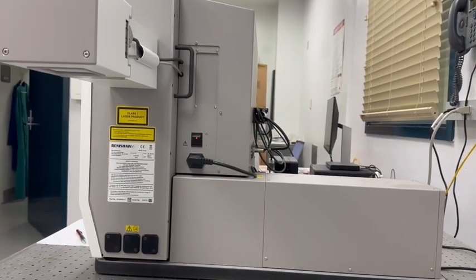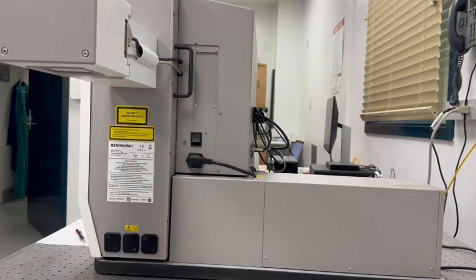This concludes the Raman microscope training video, and we look forward to seeing you for in-person training.